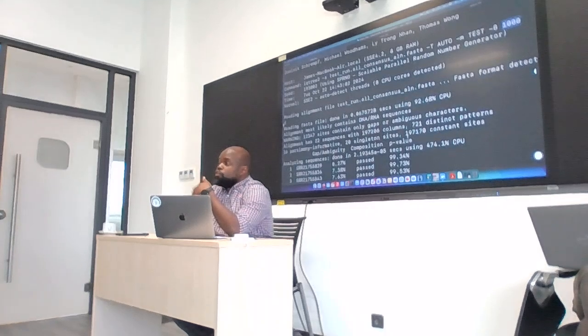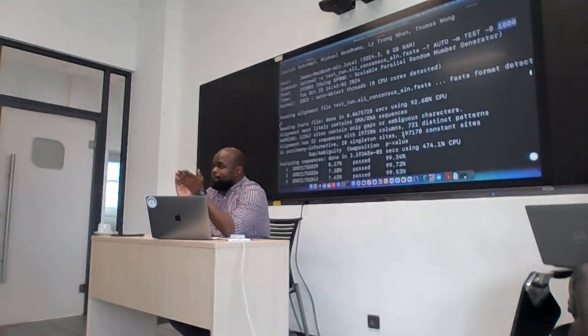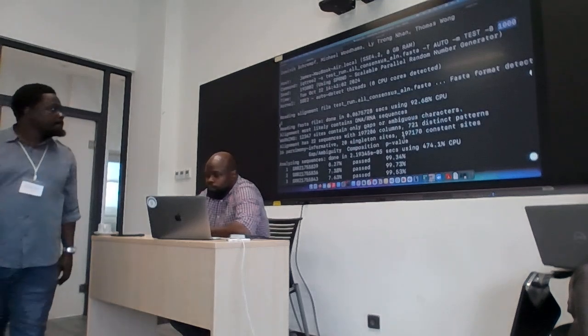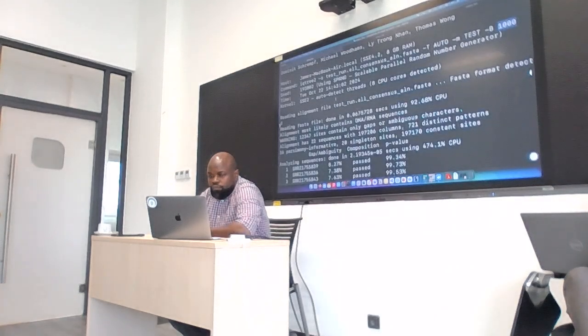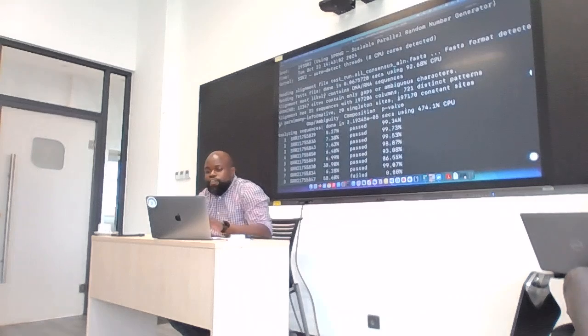Just want to go through what IQ-TREE was doing, okay? For instance, did it finish? Okay, I think let's move. So you'll see that IQ-TREE did read in the file.